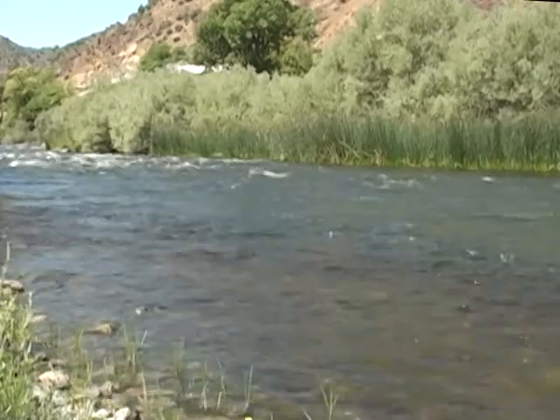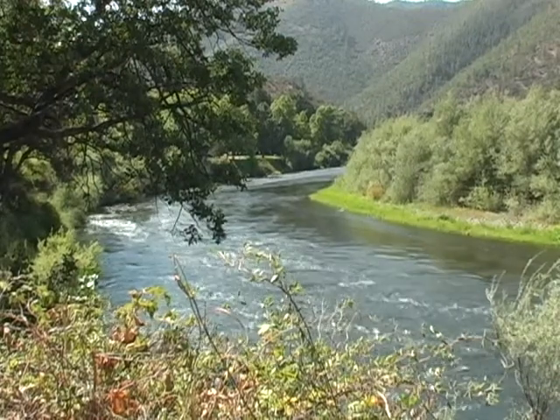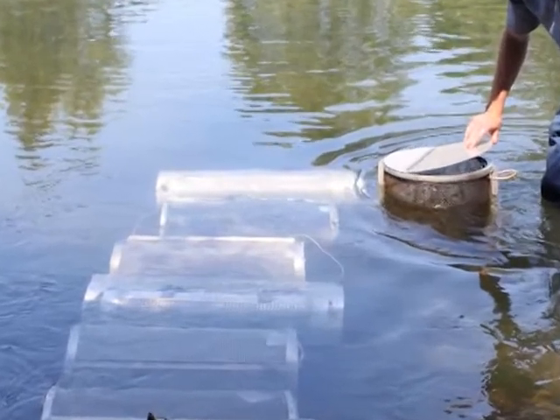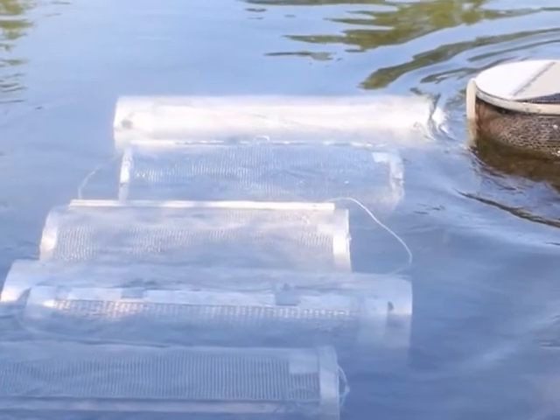After PCR has amplified the DNA, here you can see the results of a gel where we have our positive control and our positive samples here. So these fish have Ceratomyxa shasta, whereas these fish are not infected. Through sentinel fish exposure, laboratory examination, and PCR, we can gather information on how many fish become infected and how severe the infection is. We can place fish in the river at different sites at different times of the year to better understand when and where the parasite is present.